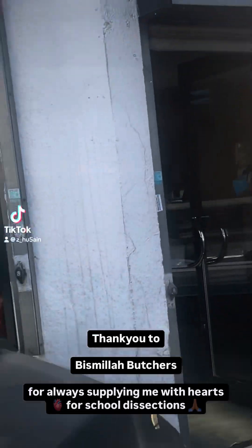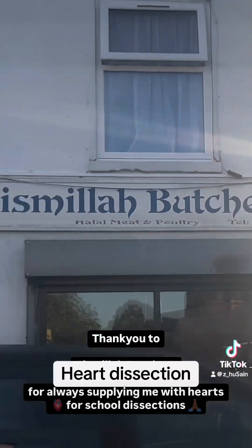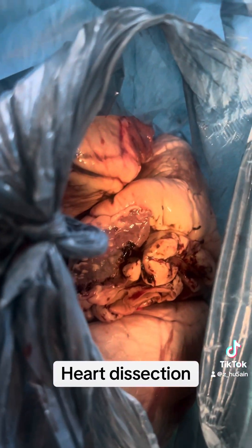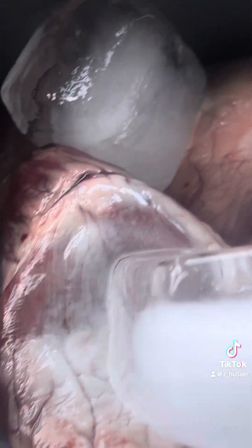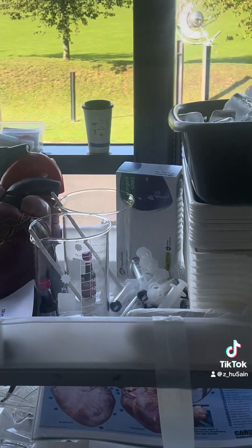It's giving me three hearts. So if you need your butchers — trolley full of hearts. I've got ice cubes on these because I need to keep them cold; I've got three lessons of this. So here's a heart, syringe, food dyes. Right, let's give it a shot.